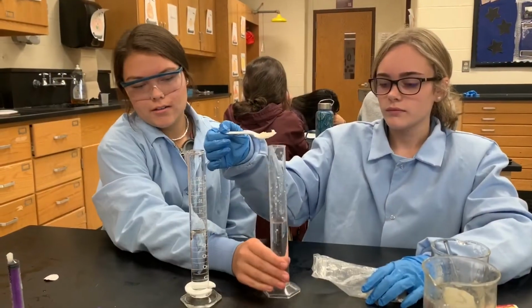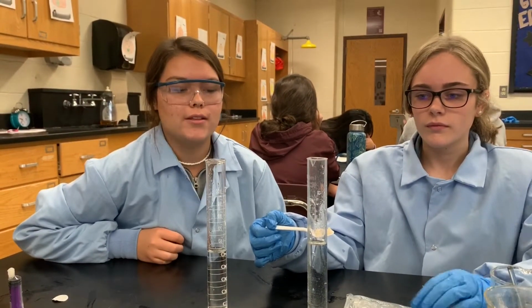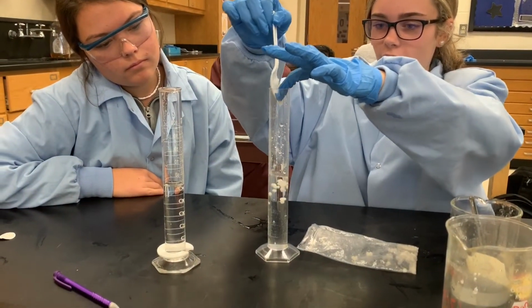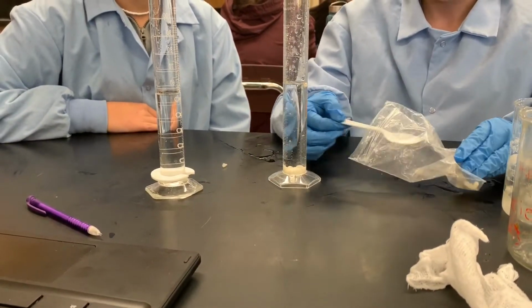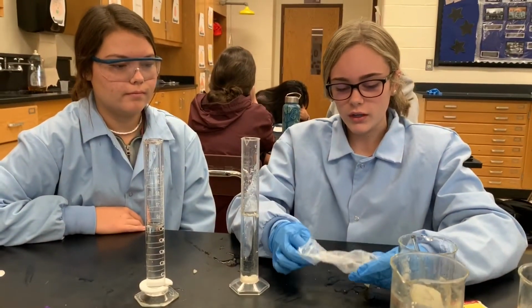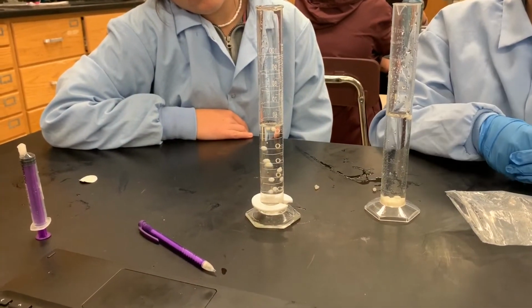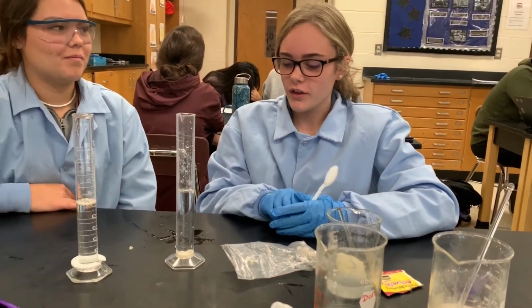We have our negative control and our positive control. The negative control is water, and the spheres will not rise in it, but the hydrogen peroxide will cause the spheres to float. The sphere will sink to the bottom of the cylinder, then a catalase produced by the yeast reacts with the hydrogen peroxide to form O2 gas bubbles around the sphere. This causes the spheres to rise to the surface. The more concentrated the hydrogen peroxide solution is, the faster the spheres will rise.